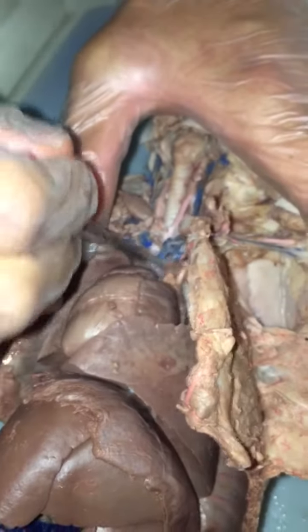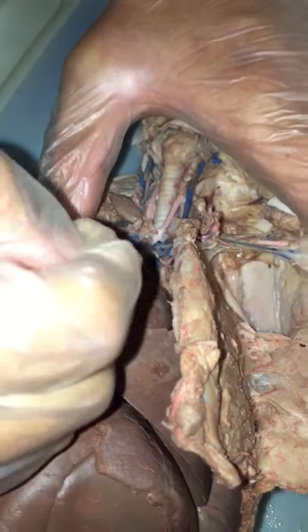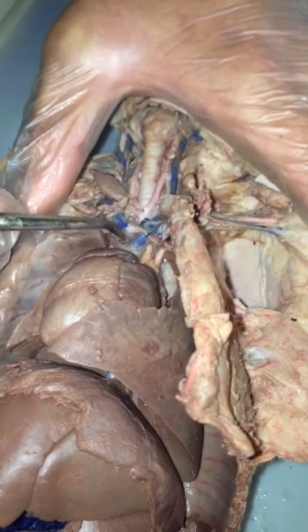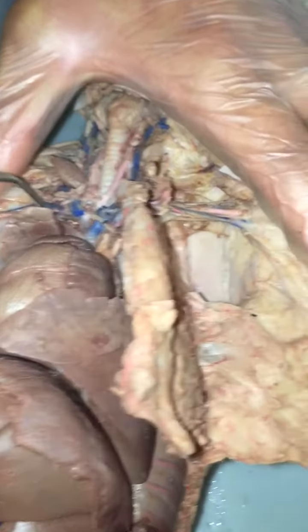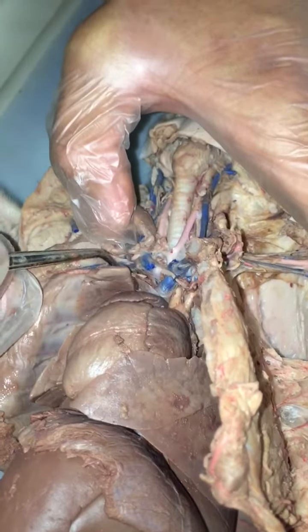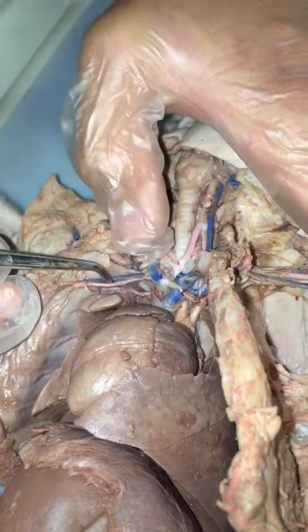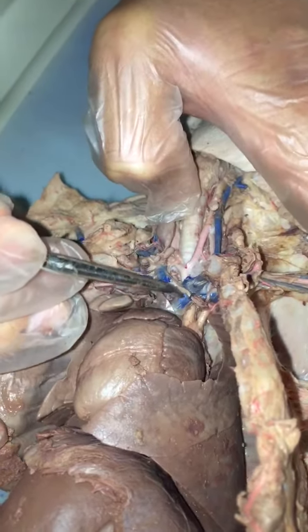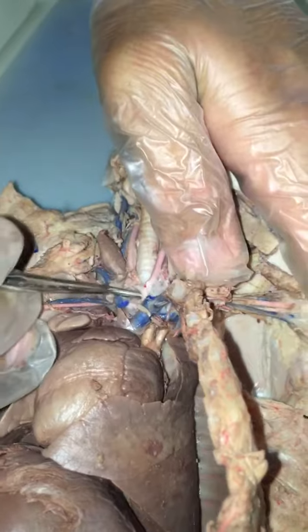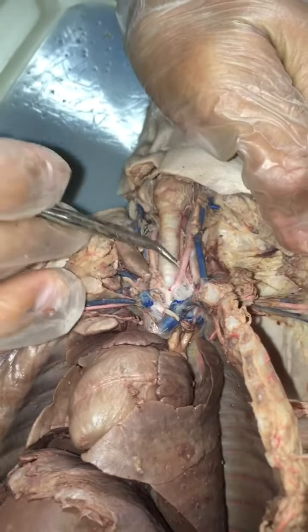Okay, well, let's come off the brachiocephalic again, because I don't know if you got it on the video. So, first branch off the aorta, right here. This first branch is brachiocephalic. And then the brachiocephalic will go up a little ways, and then go off to the right. And that first branch off to the right is this one, which is the right subclavian artery. And then going back to brachiocephalic, once you come up, instead of turning right to the right subclavian artery, you just keep going straight. You'll come to the common carotid trunk right here, which splits into the common carotid arteries, right and left.